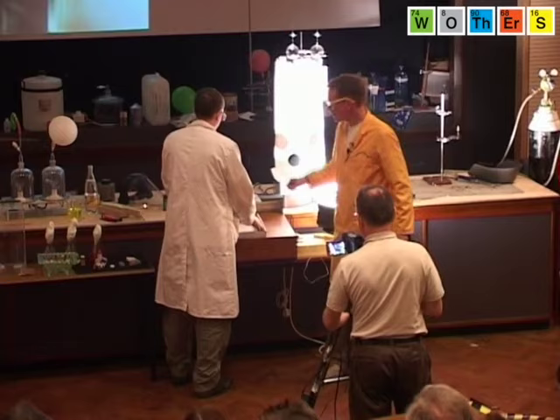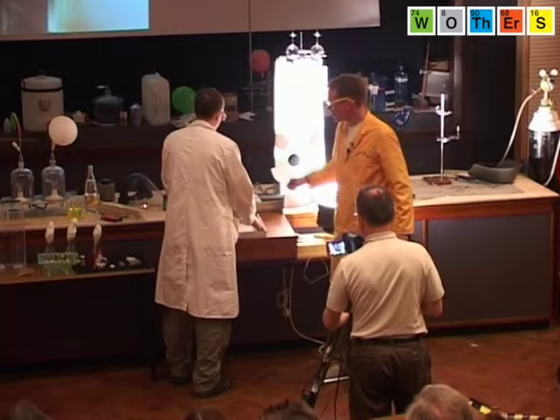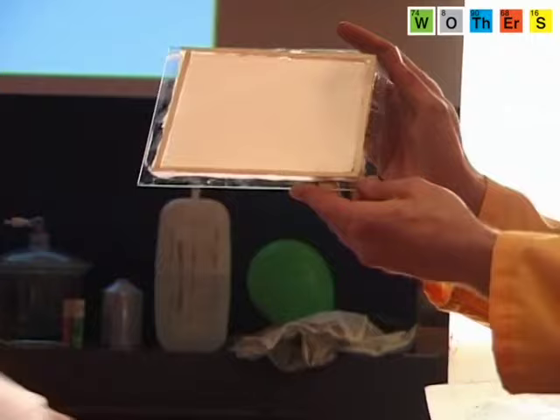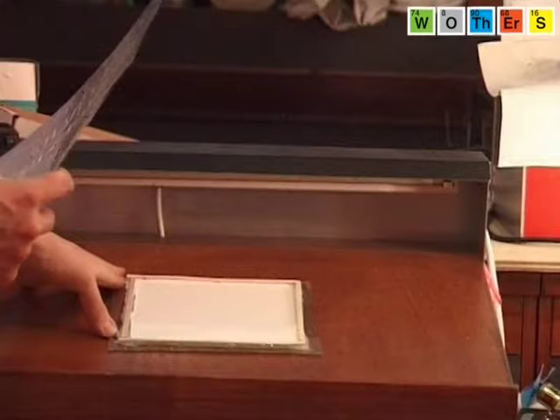Now, we have here a plate. We've made this with some jelly and some silver chloride. And at the moment, this is a nice white colour. Now, we're going to put a mask over this and shine some light on it.